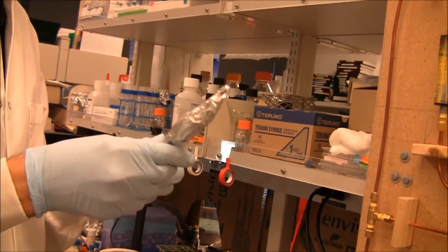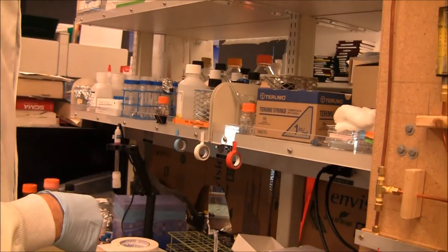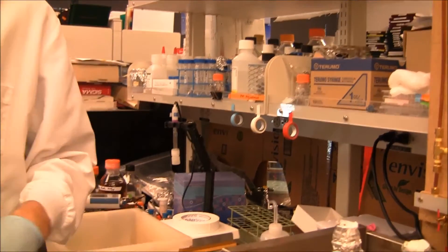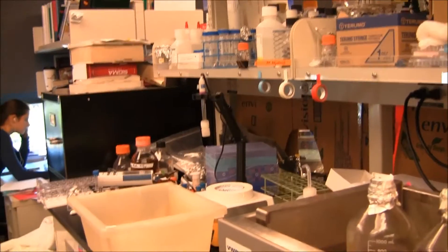And so now, I have a couple of tubes that I've autoclaved. Let me be extra careful, I'm just gonna wash my hands with some ethanol.